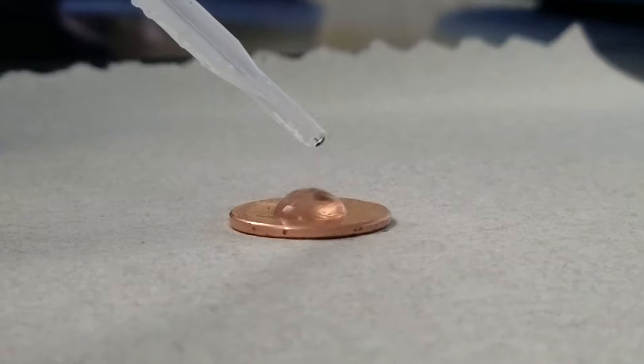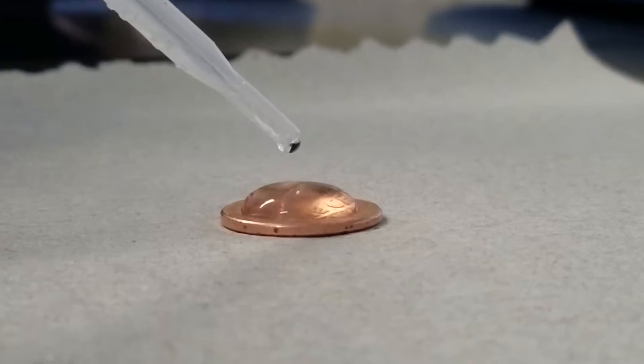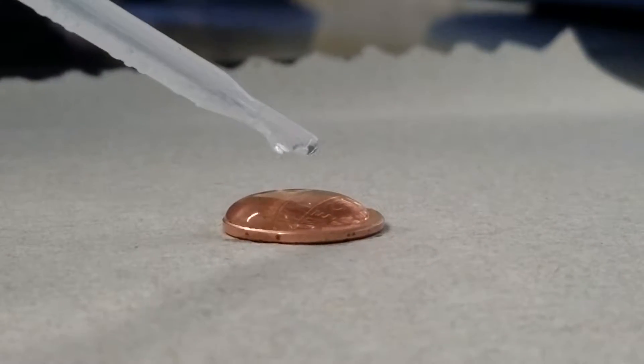Use your pipette to add distilled water onto the penny, drop by drop, until it overflows. And make sure to count the drops.